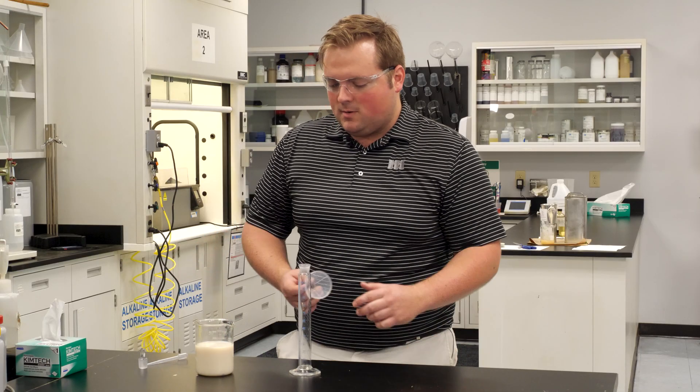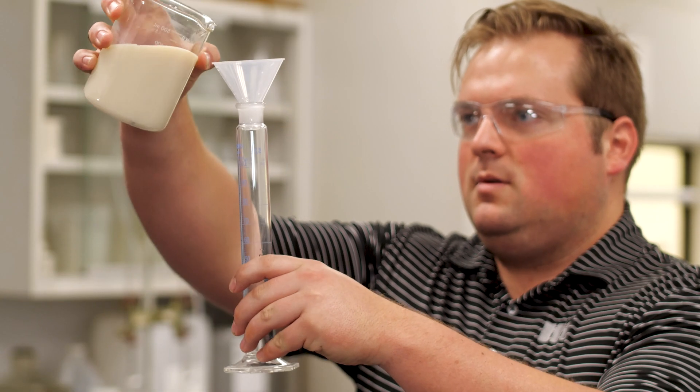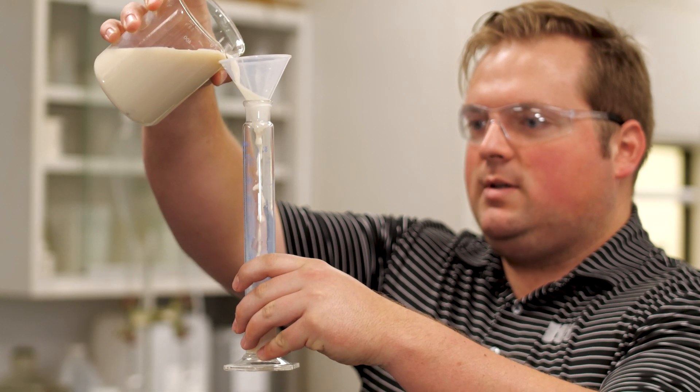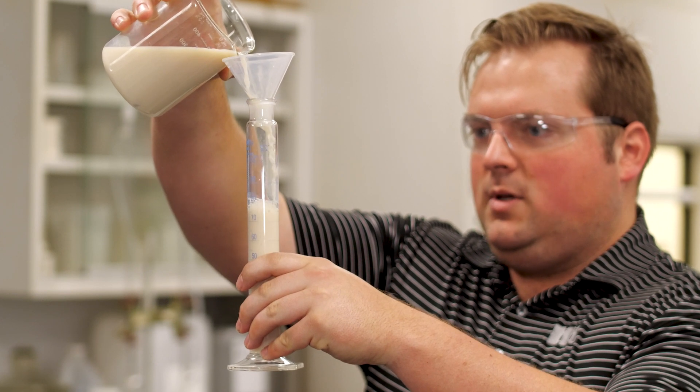For that test, we're going to take a determined volume of the sample solution. Using a graduated cylinder, we're going to measure out 90 mils.